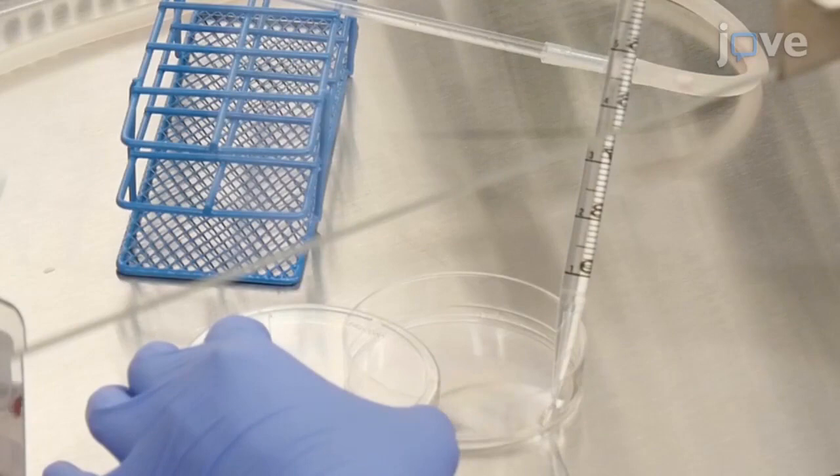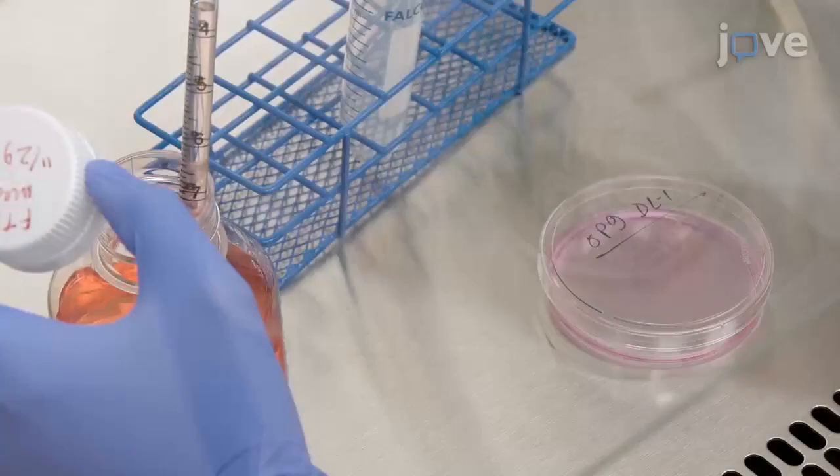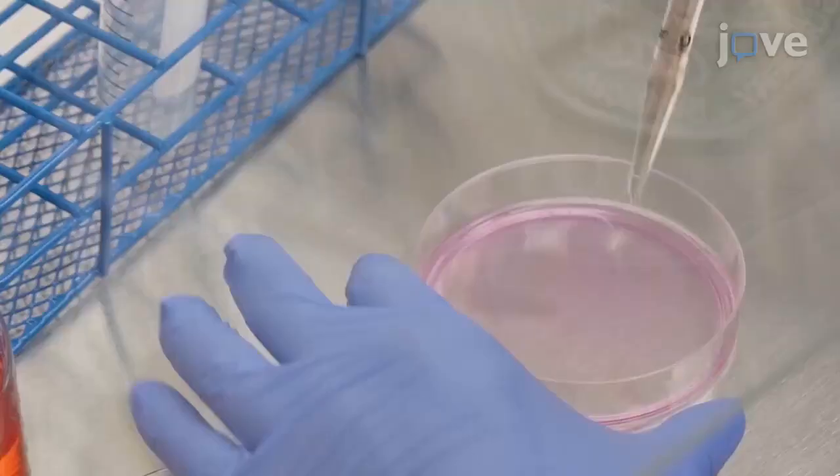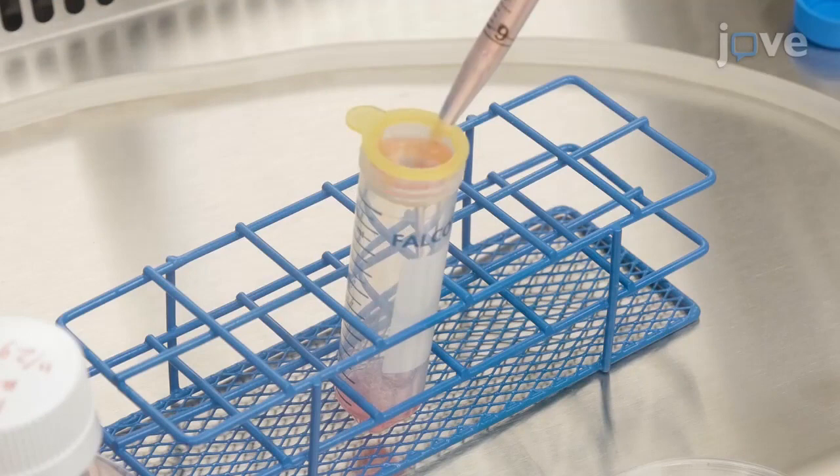Add 4 mL of 0.05% trypsin and incubate at 37 degrees Celsius for 5 minutes. Then add 4 mL of OP9 media and pipette to dissociate the cell layer and make a single-cell suspension.